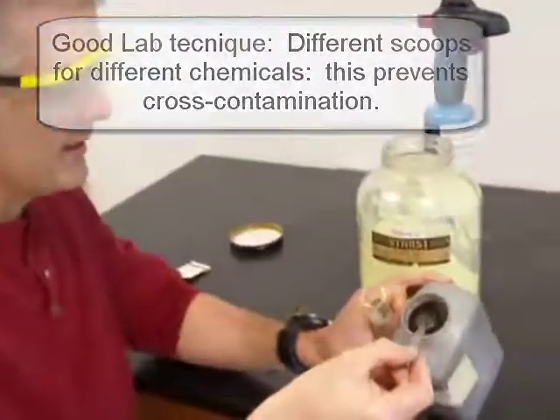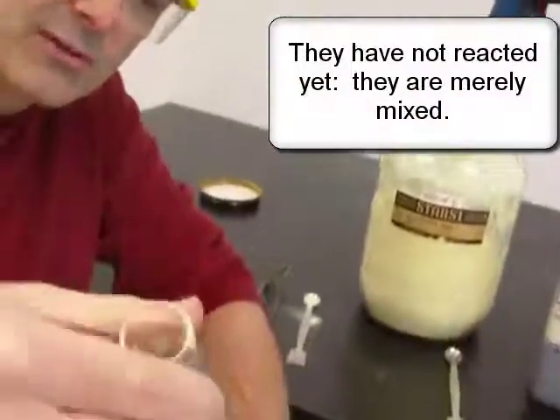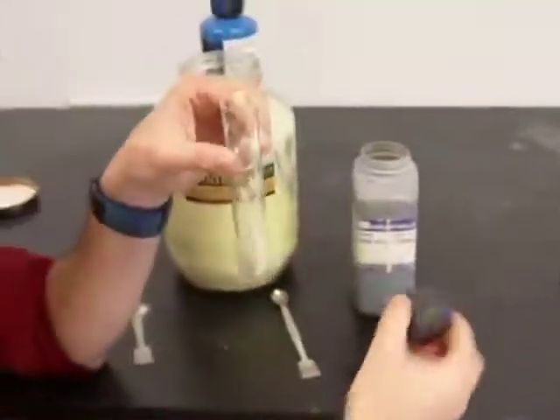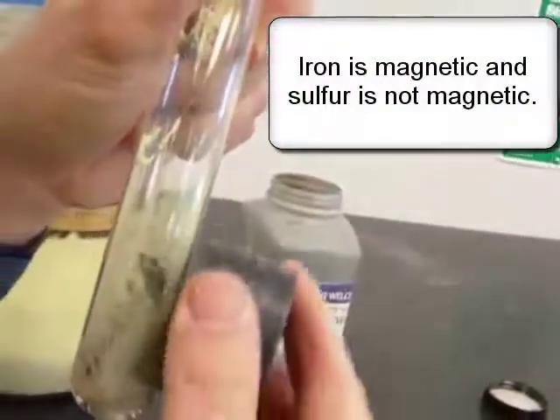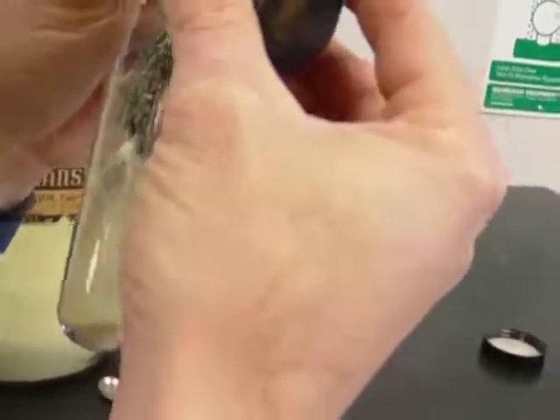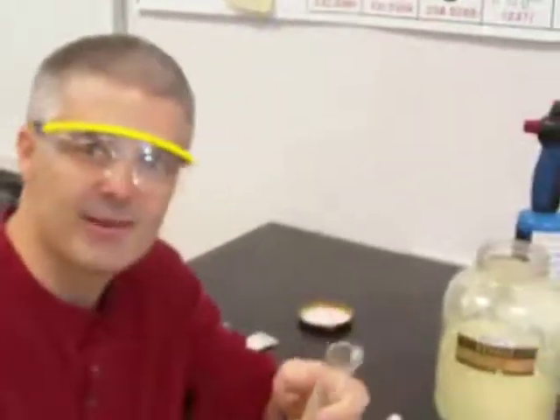Here is iron mixed with sulfur. Notice they're not reacting — they're just mixed together. I'm going to shake them up. They still haven't reacted. One way I can confirm this is with a magnet. I can move the iron around — iron is attracted to the magnet. The sulfur stays at the bottom because sulfur is not attracted to the magnet, but the iron is. So this is essentially just a mixture. To get them to react, we need heat!